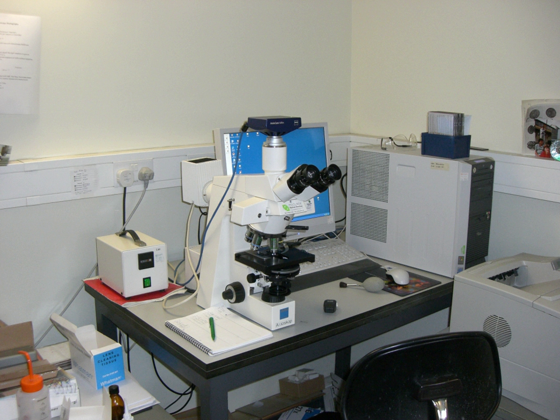Adjustment knobs move the stage up and down with separate adjustment for coarse and fine focusing. The same controls enable the microscope to adjust to specimens of different thickness. In older designs of microscopes, the focus adjustment wheels move the microscope tube up or down relative to the stand and had a fixed stage.